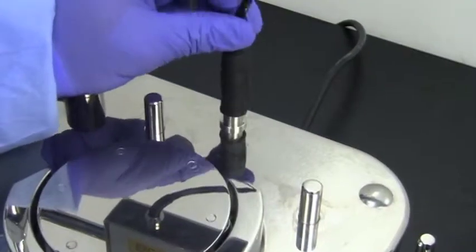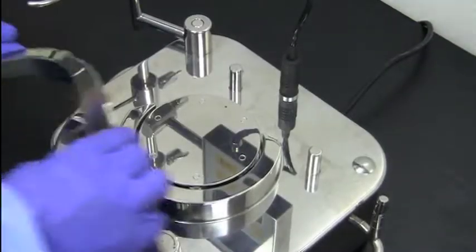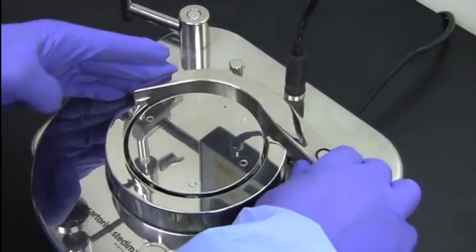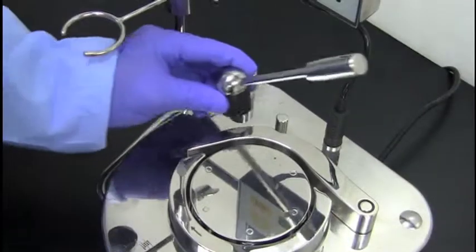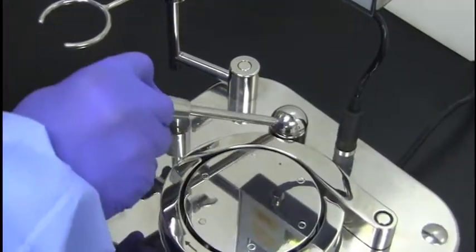Then connect the cord to the pump housing via the link lock system. Attach the bow to the rear of the pump head. Attach the lever to the pin behind the bow, and turn it clockwise to lock into place.